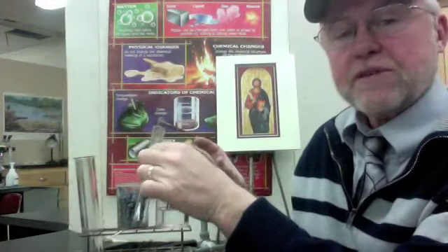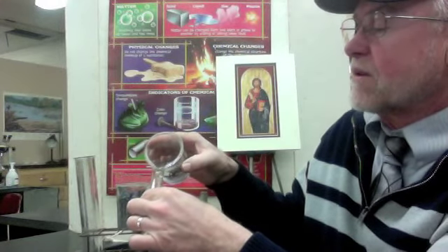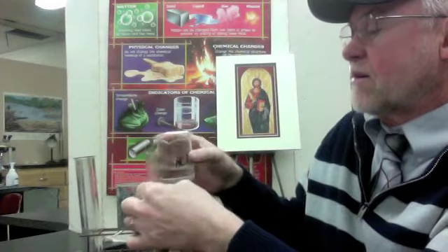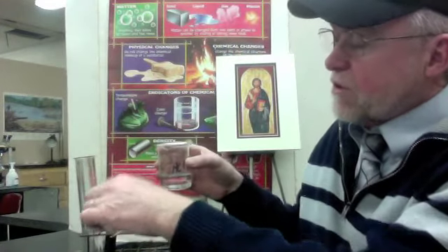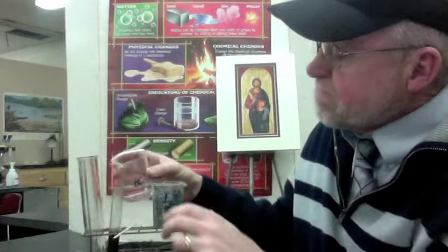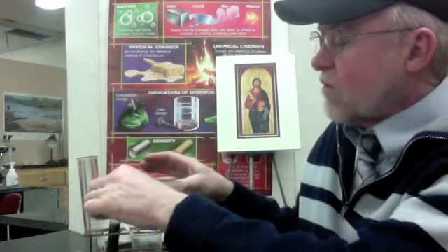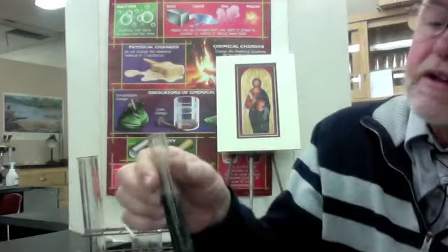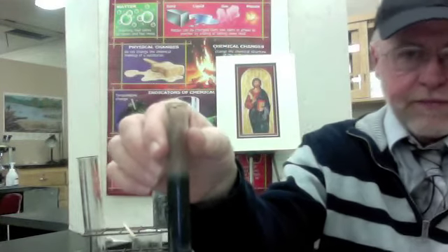Okay, so I've got some zinc here. Now I'm going to add some hydrochloric acid. And there we go. Boy, it got all black in there. Well, I wish it wasn't black, but it's black. Okay. I tell you what we do have going in here, though, I don't know if you can see this or not, but it's just bubbling, bubbling, bubbling. That means a gas is being produced.